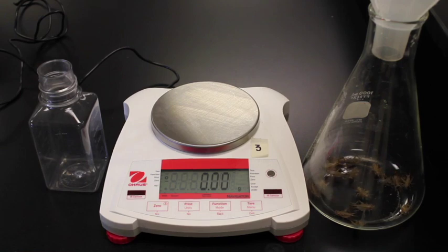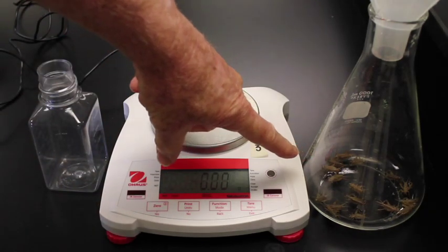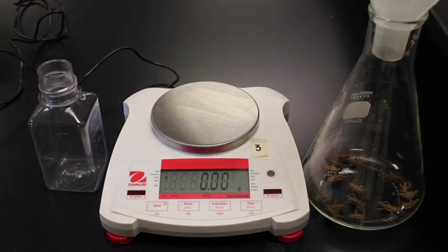Now if you look at the crickets, they're all different sizes. And so 5 crickets then would have a different mass. Typically in science you want to replicate your experiments. When you replicate your experiments, in order to analyze your data, you need to have each replicate on the same scale. So we could do 5 crickets as our scale and divide everything by 5 and go per cricket. But since 5 crickets have a different mass, it would be more appropriate to actually mass the crickets, divide by the mass of the crickets and go per gram, which would be much more accurate in moving on.